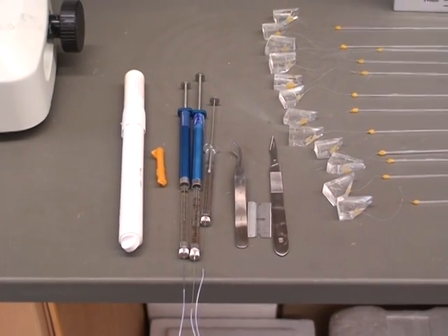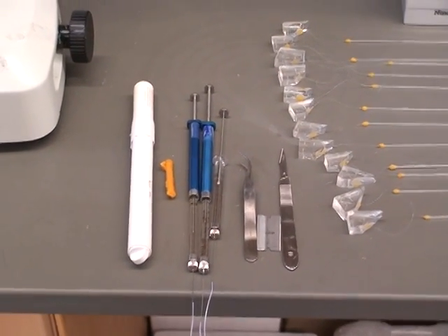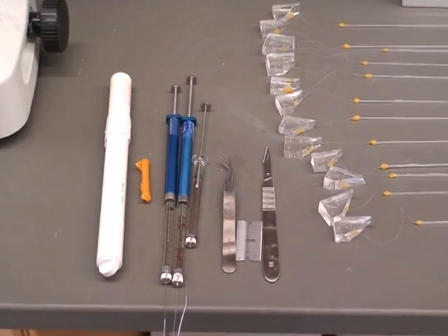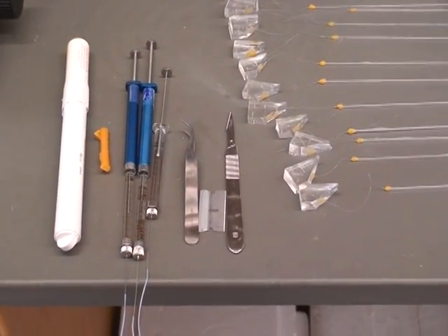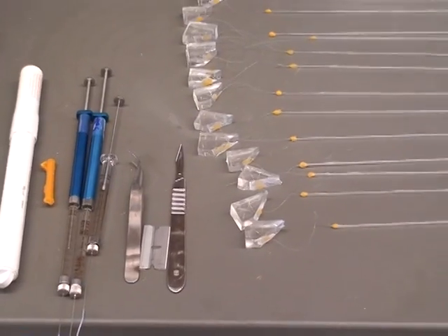Along with some wax, which will be used to seal all the ends of the tubings, some syringes to flow the solutions through the PDMS device, a pair of tweezers, and a couple of razor blades for cutting.